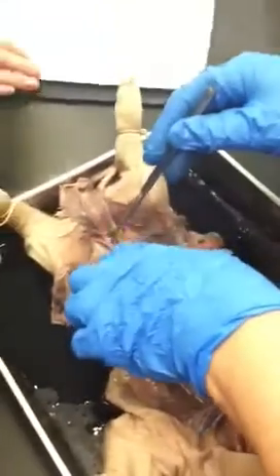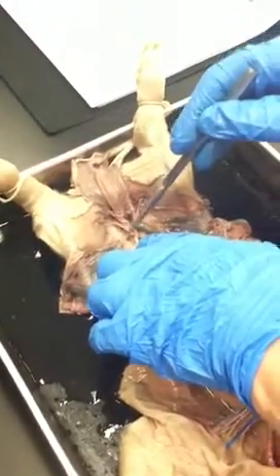Any of them I didn't get? Renal, gonadal, posterior, external. Iliolumbar? The iliolumbar is going to be that first one off of that external iliac. So see this guy, it's not going anywhere near the leg. It's heading towards the skin in the back.